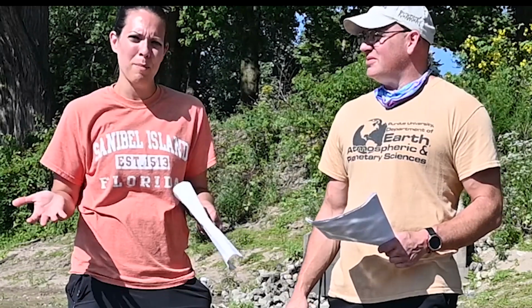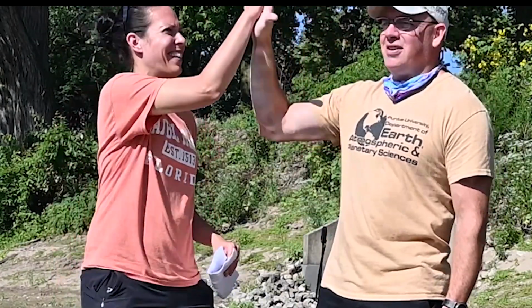We're right here at the Wabash River, and we're going to be looking at some different things that we can do to take measurements of the water that we're observing. But before we actually measure the water, there's other things we have to look at, right? Yes. It's very important because when we're collecting data, we're not just looking at the water saying, okay, looks nice, we're done. No, not like that. We're actually collecting data.